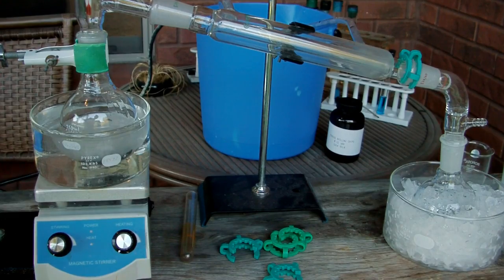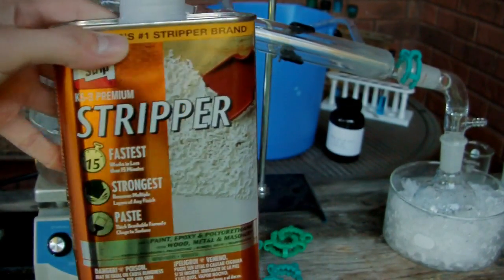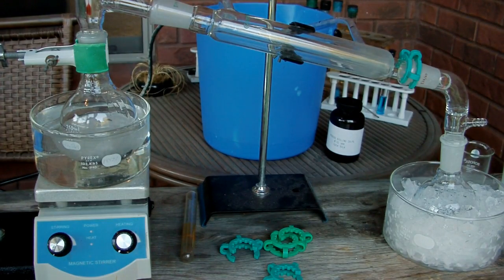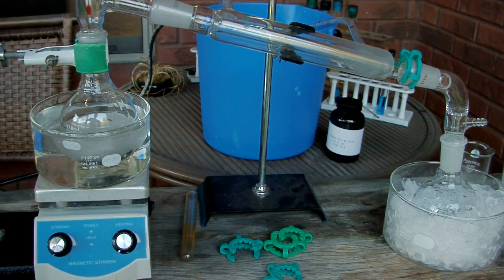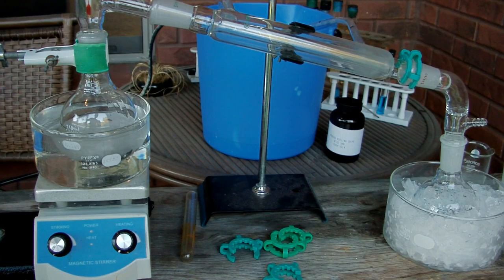So what I'm starting with is this paint stripper, KS3 premium paint stripper. According to the MSDS it's made of 60 to 100% dichloromethane, 10 to 30% methanol and then 1 to 5% petroleum distillates.